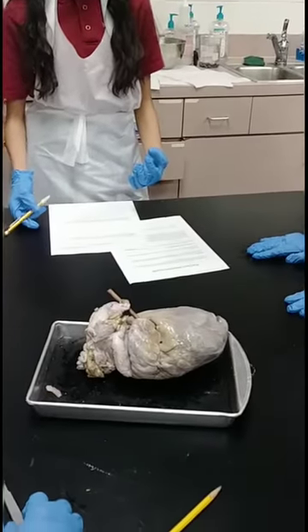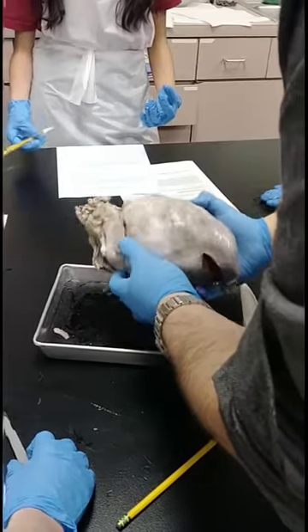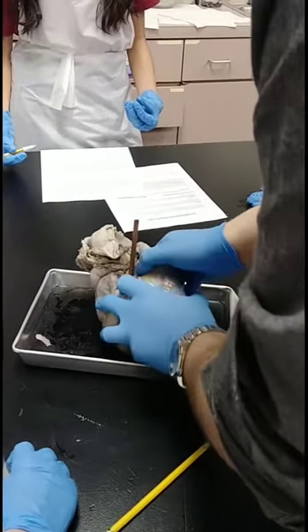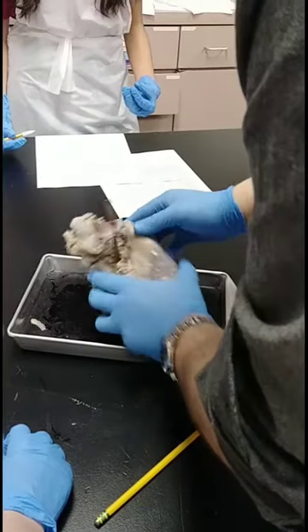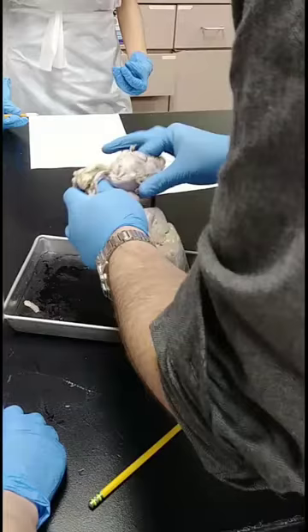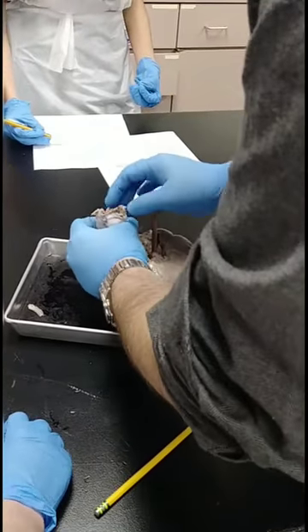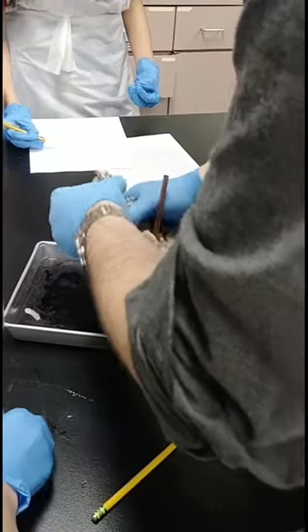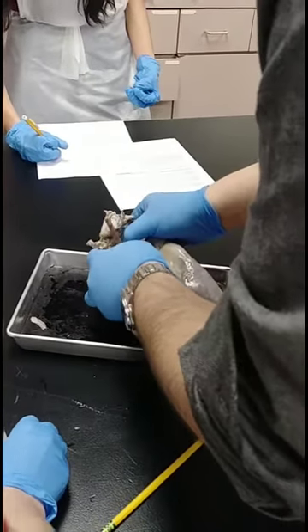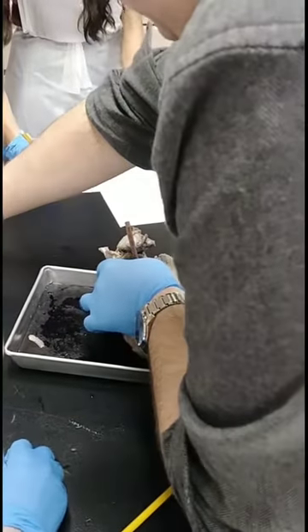Locate and label the superior and the inferior one. So what we're going to do is find the vena cava, one of them, and label that. This whole big thing is called the aortic trunk, or the pulmonary trunk. The thickest one is part of the aorta. Inside of that you have some pulmonary veins. That's probably the pulmonary artery. Probe that, mark that.